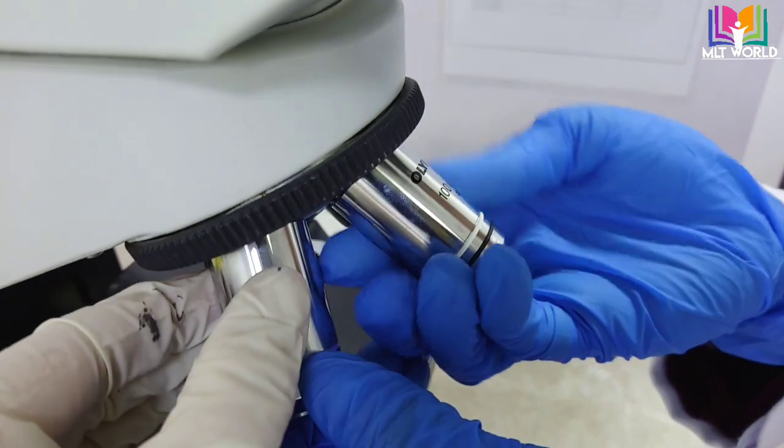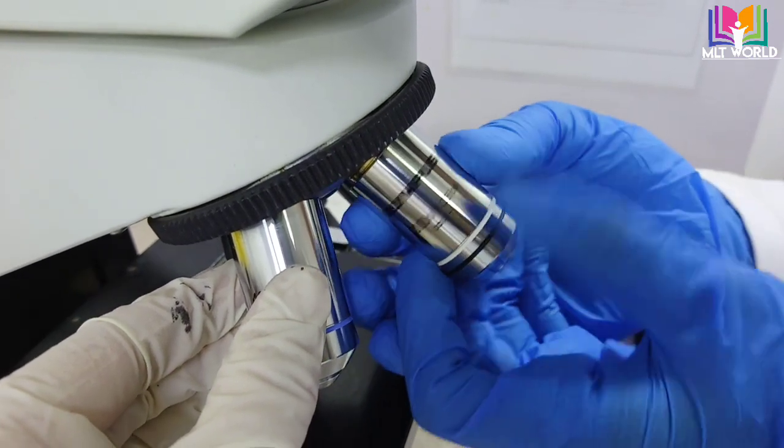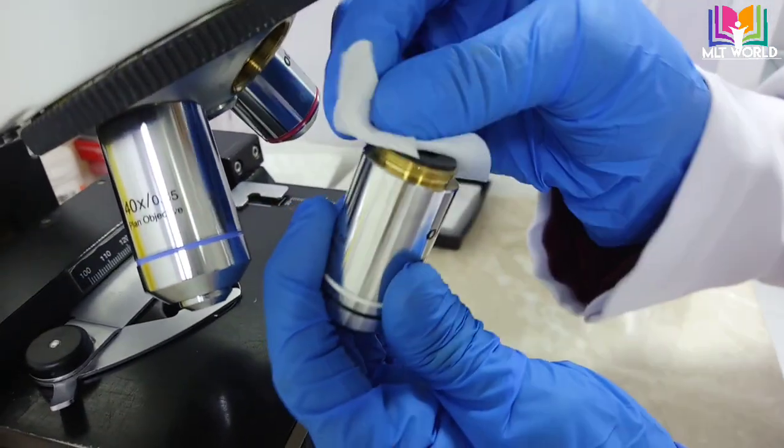Same way, we will clean the oil immersion lens. It's better to clean the oil immersion lens every three days or weekly if you are doing more blood smears.